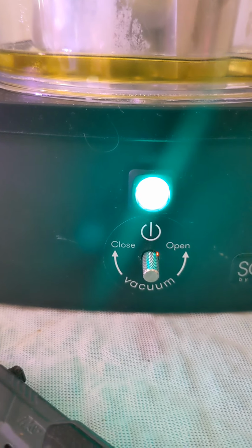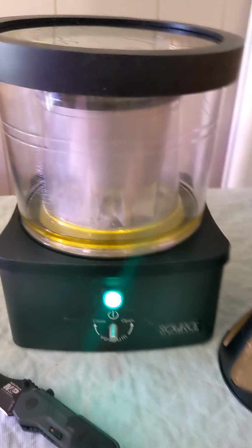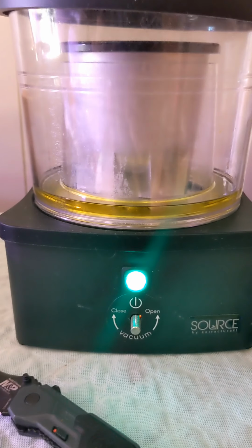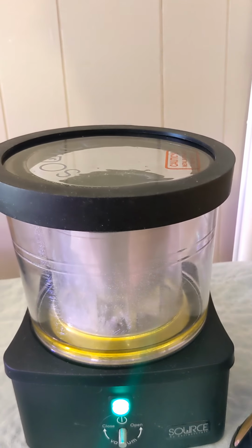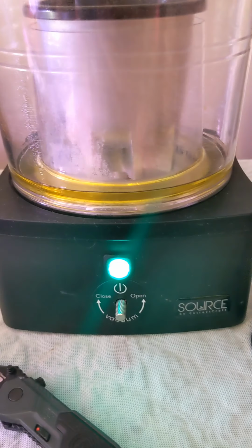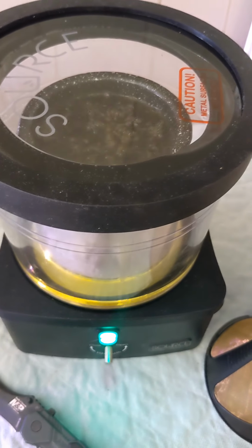This is to close and open the vacuum, and it runs on an app. I just use the Bluetooth app on my phone to start and stop the machine. You program in the altitude, then it gives you on the app the percentage of vacuum, the temperature the crucible's at, and a few other readings. The vacuum only comes on 1 or 2 minutes out of every 10 or 15 minutes, it seems. It starts at the beginning to create a good vacuum, and once the vacuum drops down to about 90 or 95%, the pump will kick on for about a minute or so and bring that vacuum level back up to 100%.